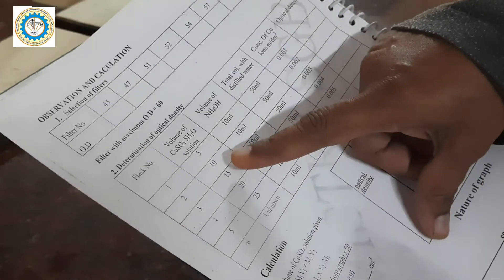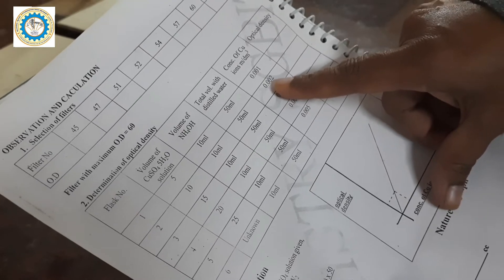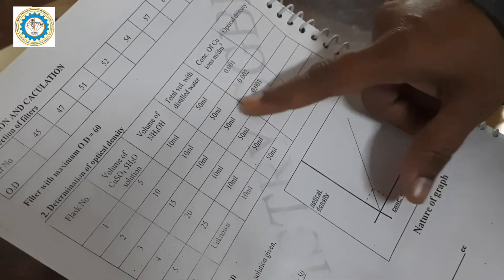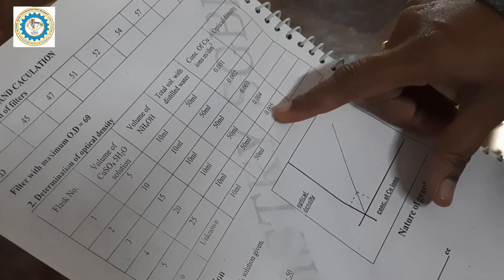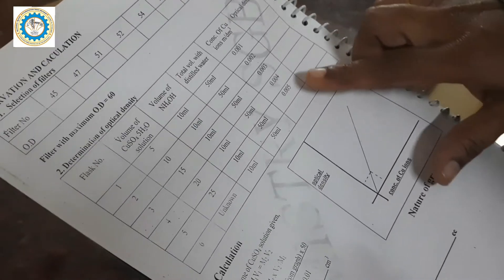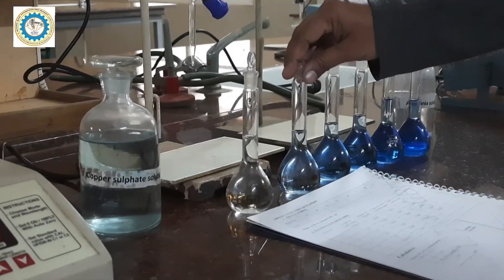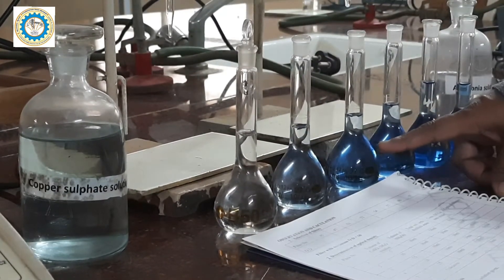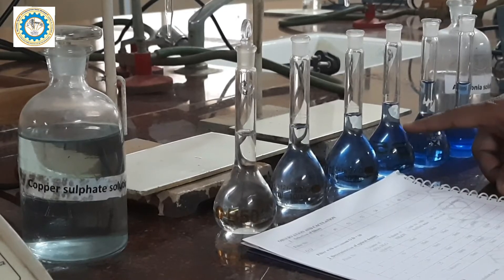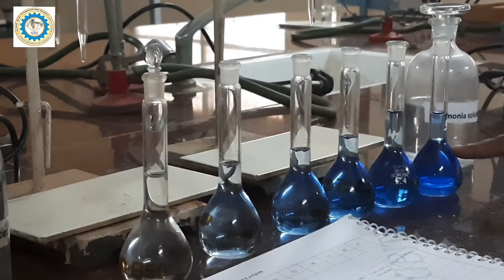Similarly, in the second one, we are going to take 10 ml of copper sulfate, 10 ml of ammonia, and make it to 50 ml, at which point we get a concentration of 0.002. We are going to prepare another 3 solutions to get concentrations of 0.003, 0.004, and 0.005. So we have prepared solutions with 5, 10, 15, 20, and 25 ml of CuSO4 respectively.